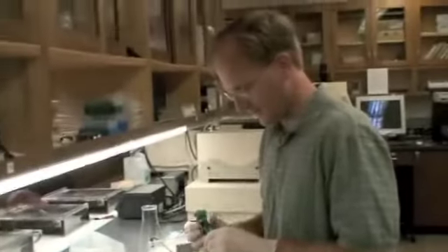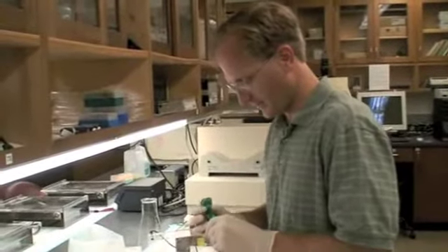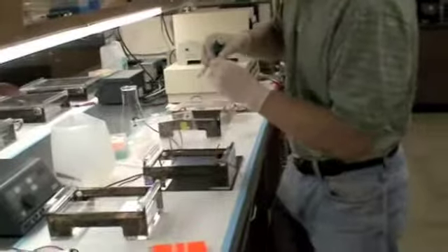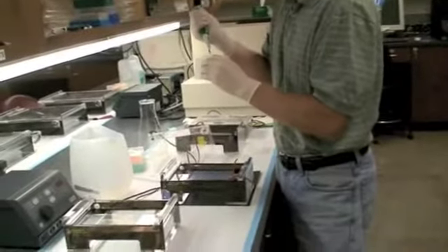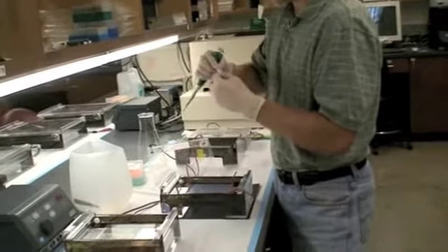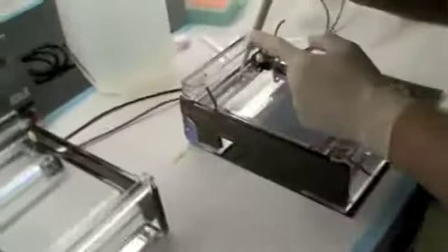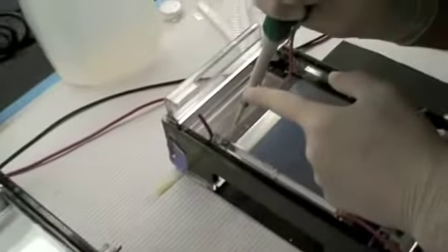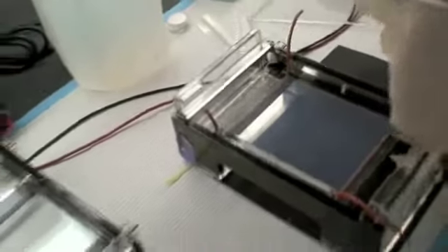So I have the ladder. We don't want to load 15 microliters, go back down to five. So we'll load five microliters. Once again, I use two hands for loading. So I'm pushing my hands together, putting the pipette in the middle. I'll put the ladder on the far left.